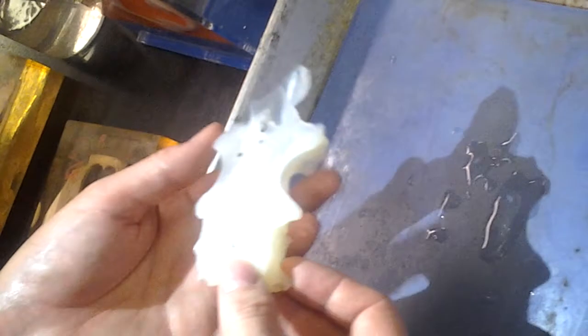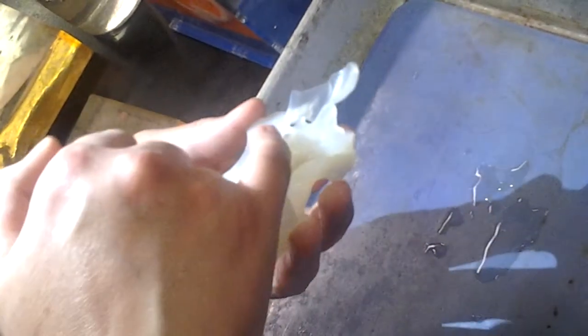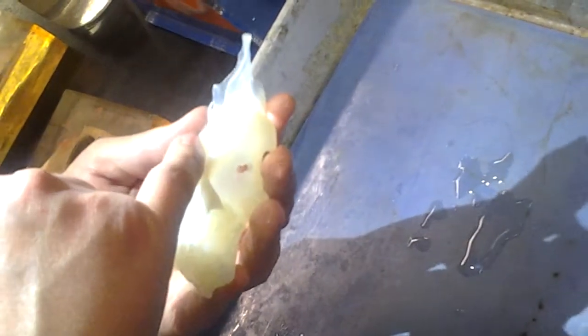And then what would you say was on the top there? This is the epiphyseal foramen here, where the epiphysis goes, the pineal body. The epiphyseal foramen. We can see it in the picture you gave us, right? There's like a bump.